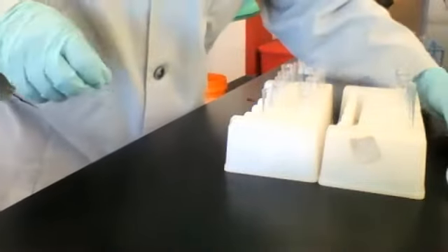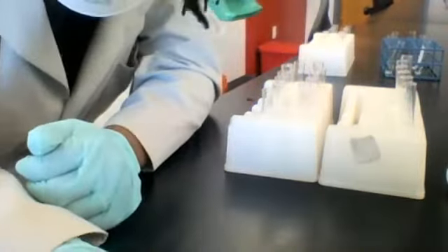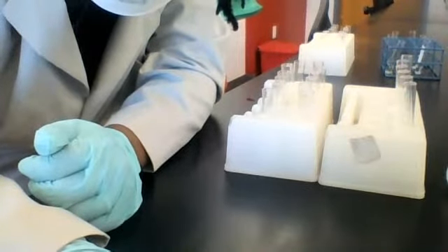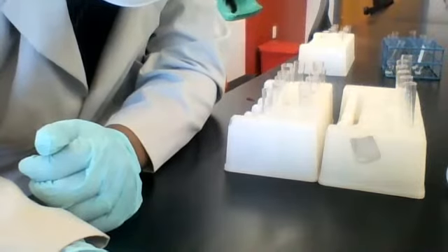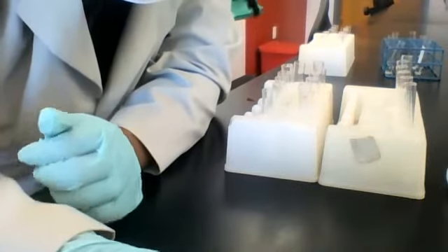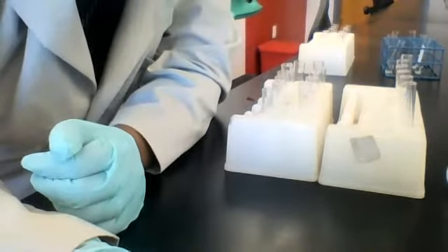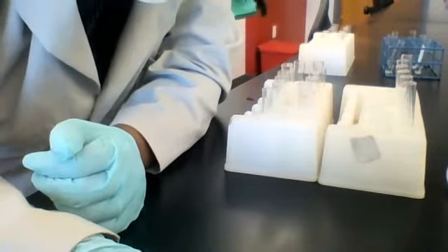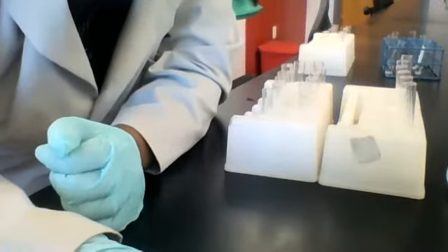All right, any questions before we move on to our second reagent? Remember, you're going to need all your observations in order to determine which compound is in this unknown and the next unknown. So if you have any questions, please ask. I'll be happy to answer, okay?